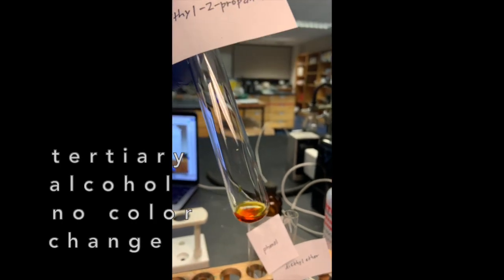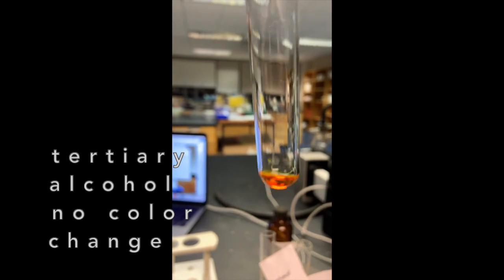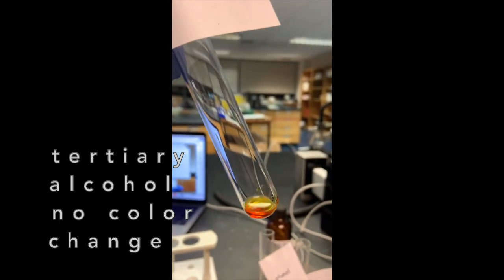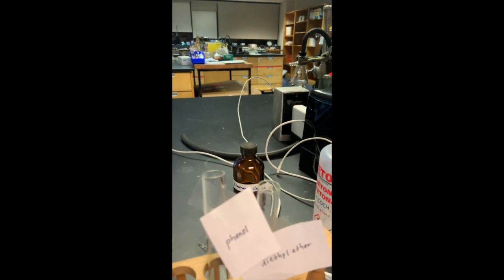This is an example of no reaction occurring. So this is my 2-methyl-2-propanol, and no oxidation of an alcohol occurred with this one, which is what we would hope to see. So it just stayed that orange color.